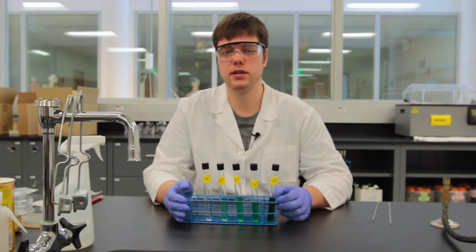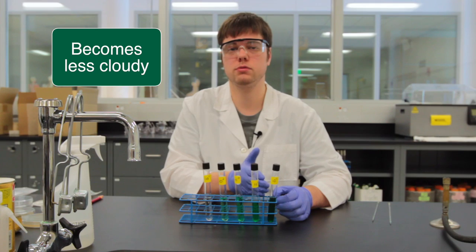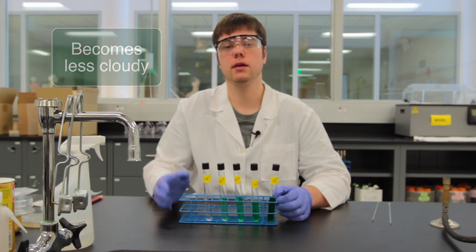In your instance you'll be dealing with bacteria, so you should notice that the turbidity of your tubes decreases as you get more and more dilute.